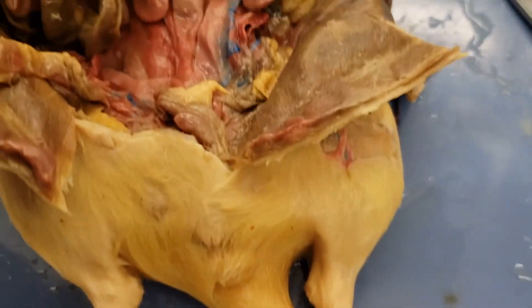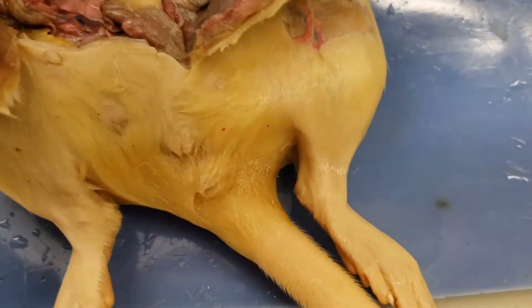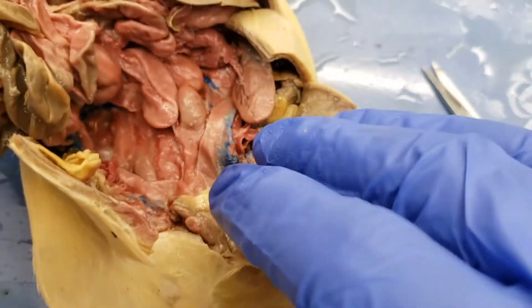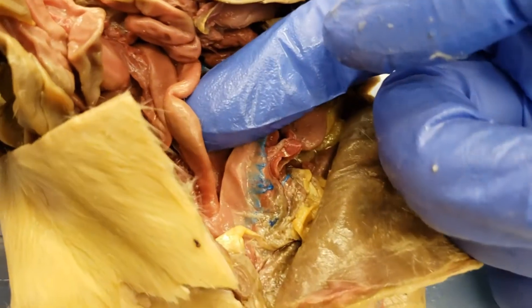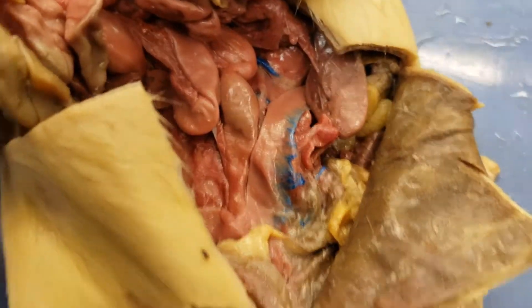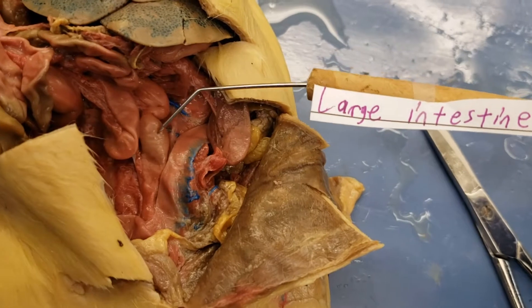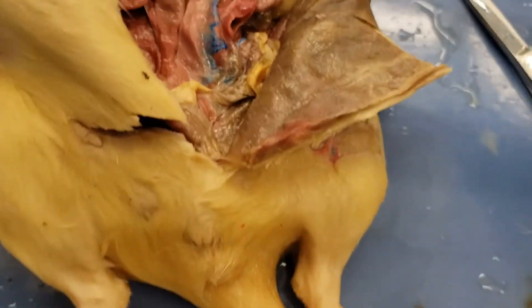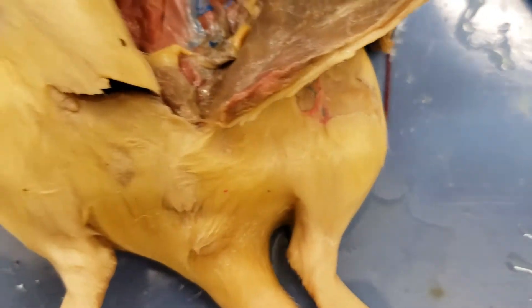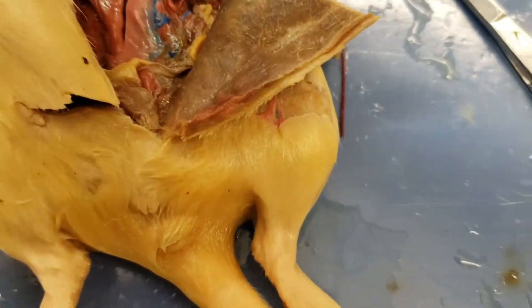The large intestines' main job is absorbing some water and leftover ions and vitamins. For the large intestines, my tip is to go near the rectum — this will be the descending colon, and there's your large intestines. You can kind of follow it around and see some of it. I think it's a little easier to see the difference in a pig personally, so I'll include a picture of a pig dissection too so you can get that comparison. I've got pictures of pig dissections just readily available.